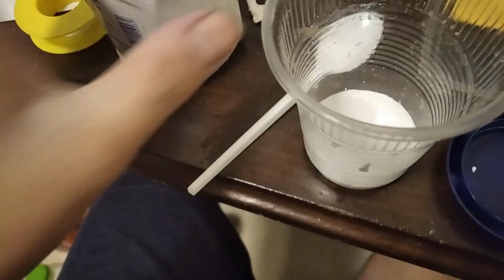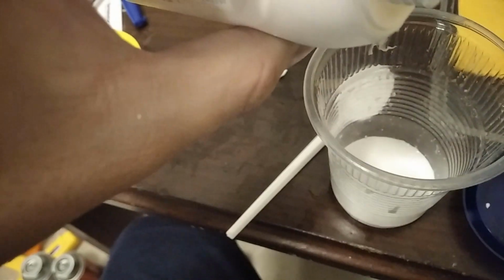So then after we get enough sodium hydrogen terephthalate, we then get some PVA primer. This PVA primer is the important agent that will become the polymer and cross-link.